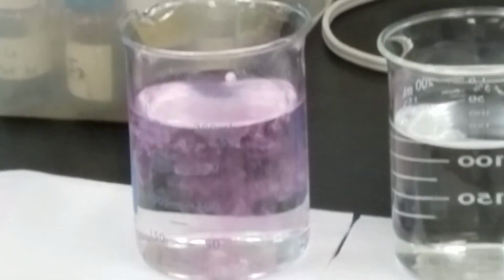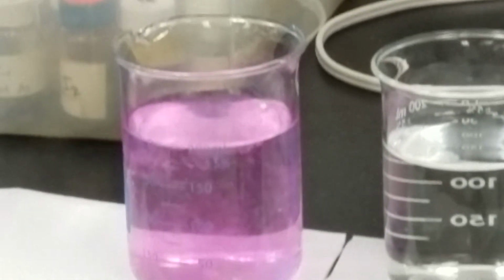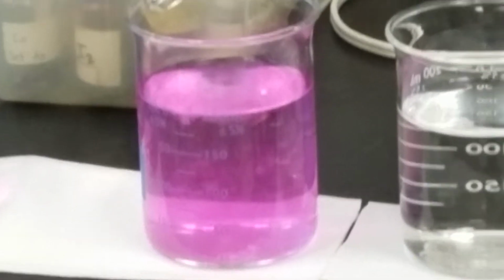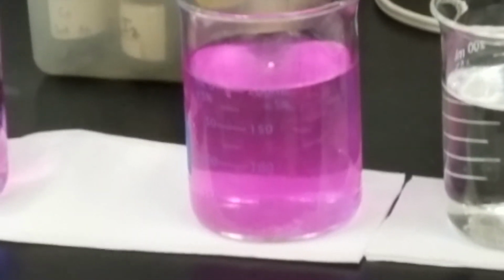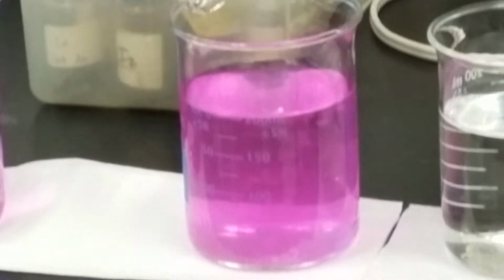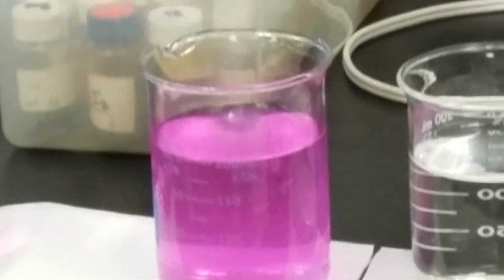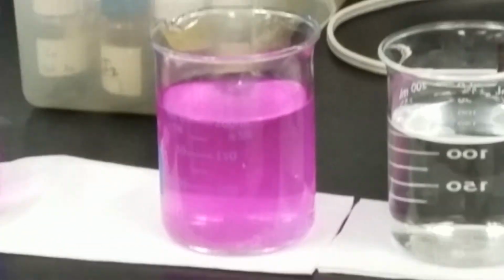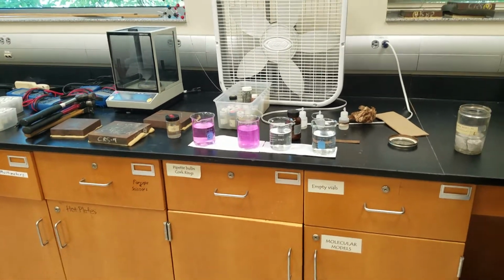You notice that it is a sphere. So that's molten sodium already, in which from the temperature, it's melted and it's just scooting around on the surface. Scooting around on a cushion of hydrogen gas as it's reacting with water to produce hydrogen gas and sodium hydroxide. What can we see about the reactivity from lithium to sodium? It's more violent. A little more reactive, and we'd expect if we go down the column that we would see that reactivity increasing.